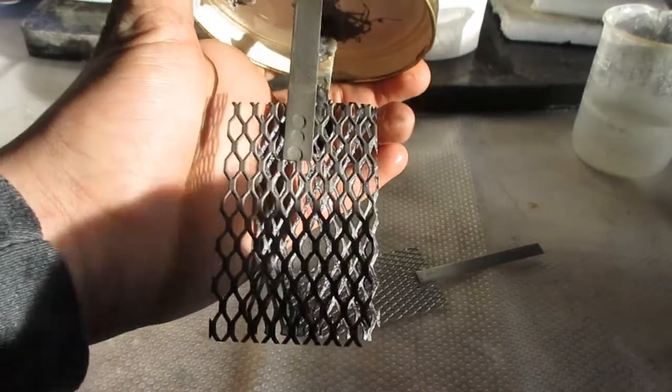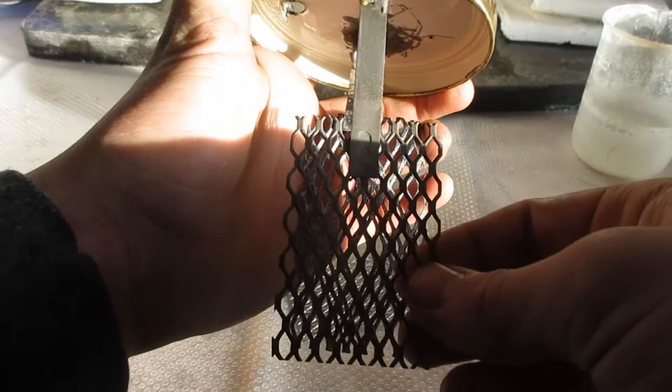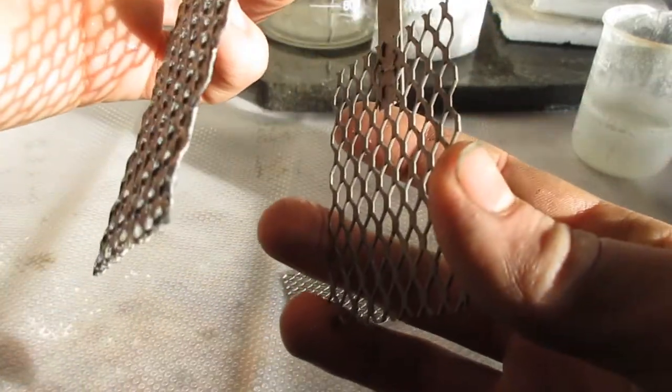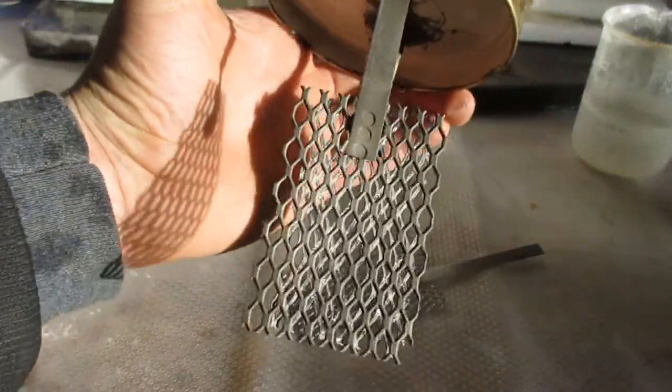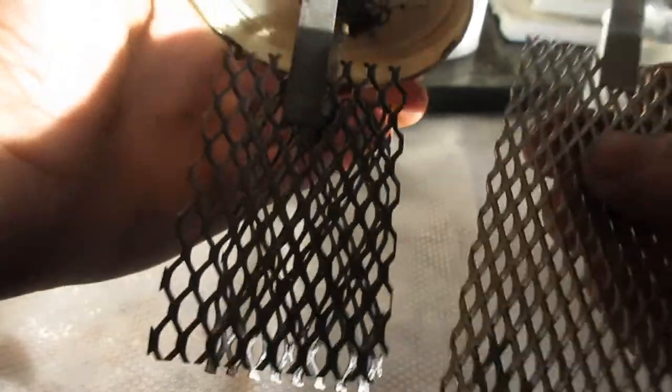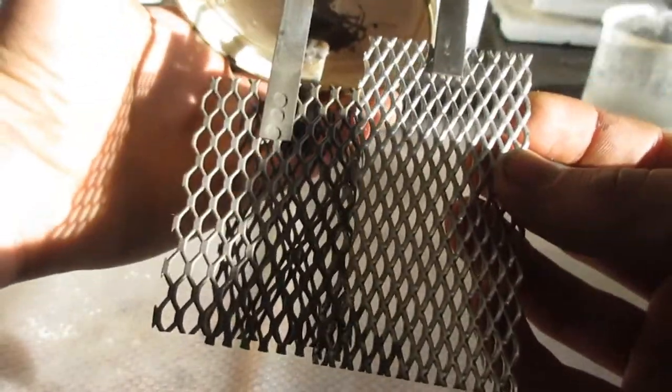So this here is a platinum anode that I've proved to be genuine, and I have been using it to make potassium chlorate for a few months. This is just a little cell I put together a few days ago. And you should be able to see a little bit of a difference here.